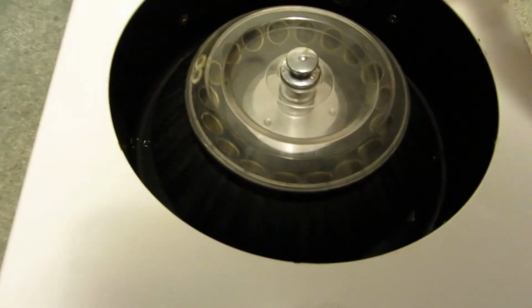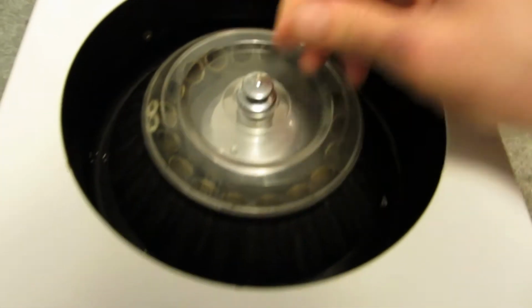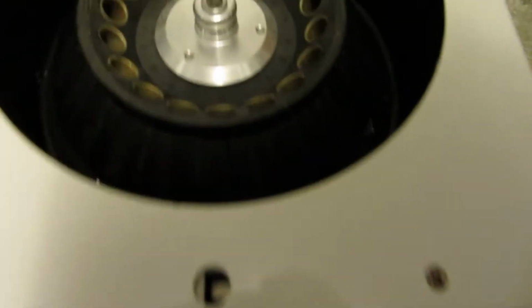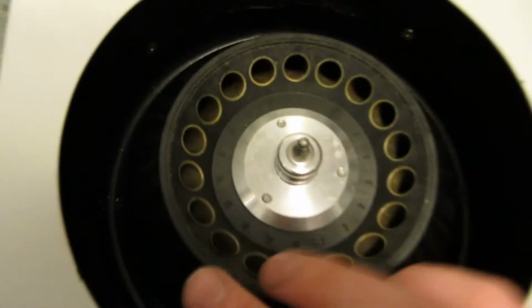I do know the centrifuge works. I have had it running. I haven't had anything in it because I don't have any of the vials, but it does run. And still in pretty good shape. Can hold, according to this, up to 18 vials.